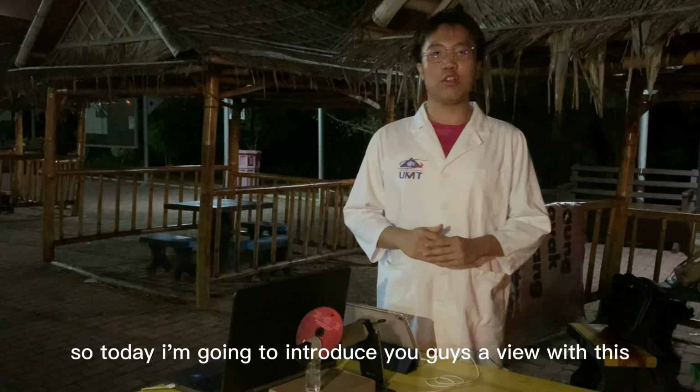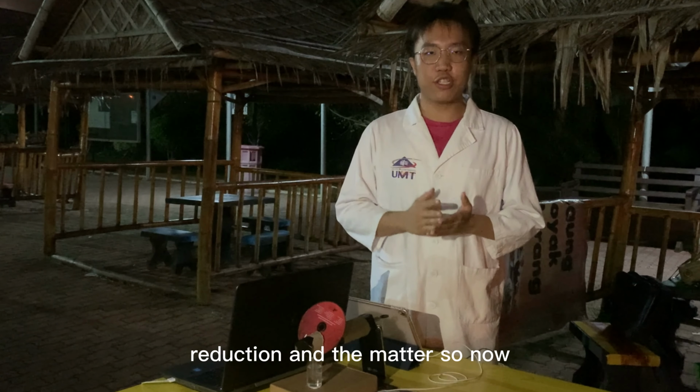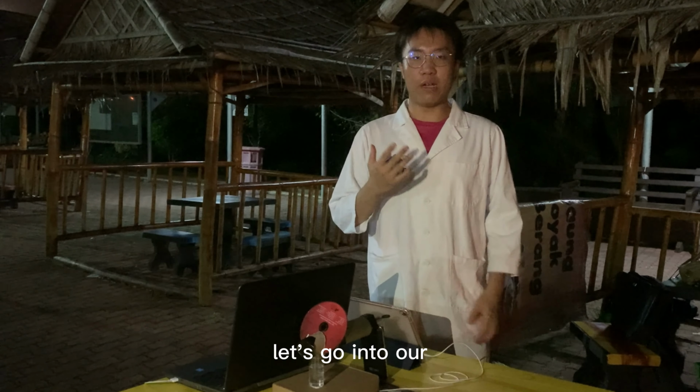So today I'm going to introduce you guys a UV-vis spectrophotometer model that was done by our group. First and foremost, what is spectroscopy? Spectroscopy is the interaction between electromagnetic radiation and matter. So now let's go into our model.